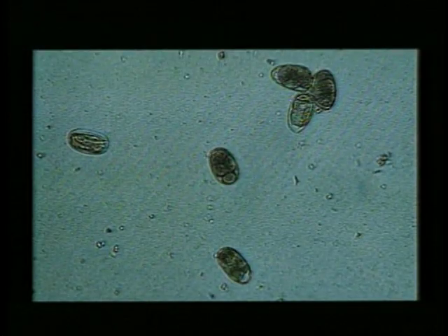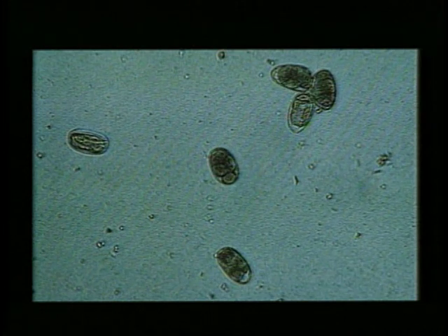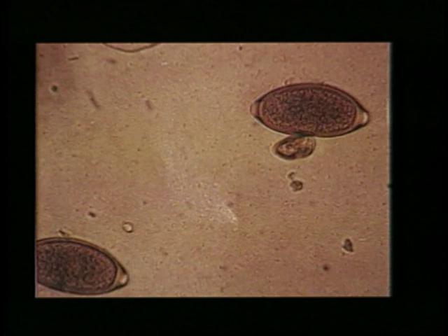The hookworm egg is ovoid in shape and contains small round cells which resemble a cluster of grapes. Hookworms are a common parasite of young kittens and puppies. The whipworm eggs are quite unusual because of their almost barrel-like appearance. You might remember this unique egg shape by imagining a barrel filled with whips.